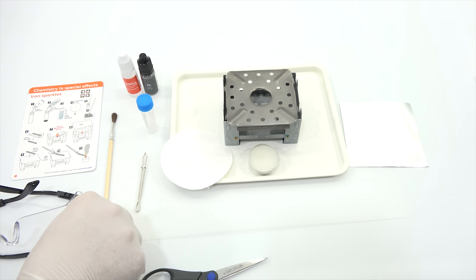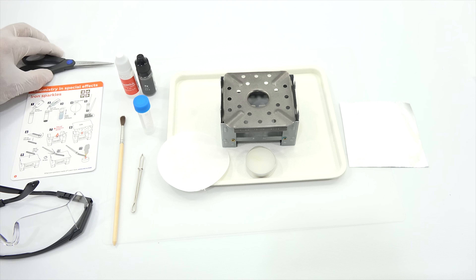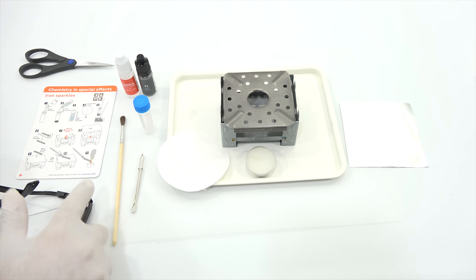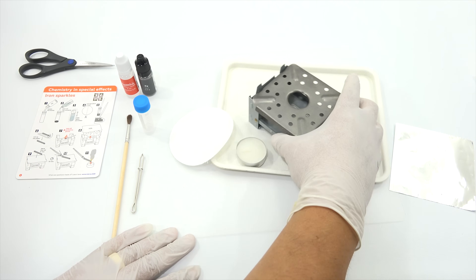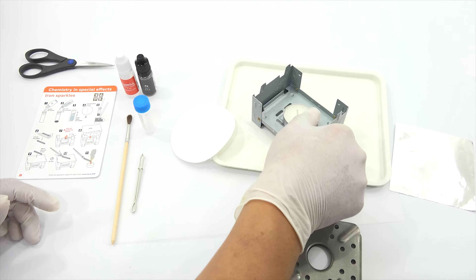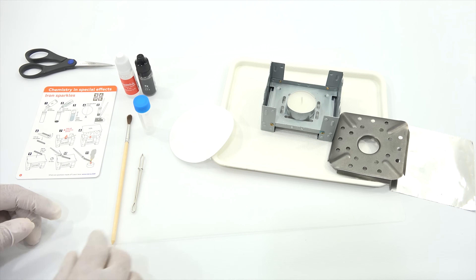I realize now that I needed the paintbrush as well, so I wasn't as accurate as I thought when grabbing items. That's why it's important to look over everything and make sure you have what you need. Scissors, which I have here. Let me get my goggles on. So step one: this goes here, and this is going to go here. Let me get the wick ready — I'll be lighting that, then putting this on, and then that on top of that.